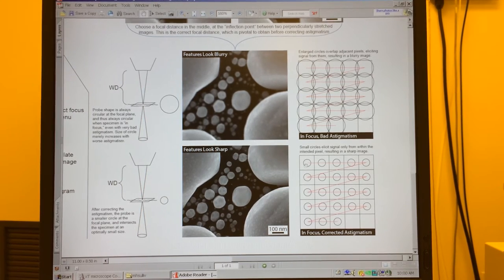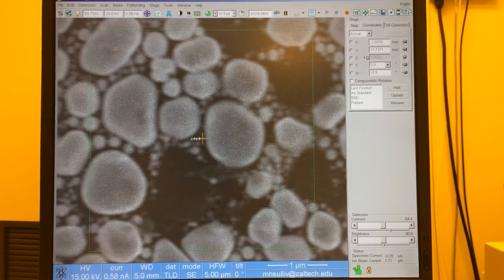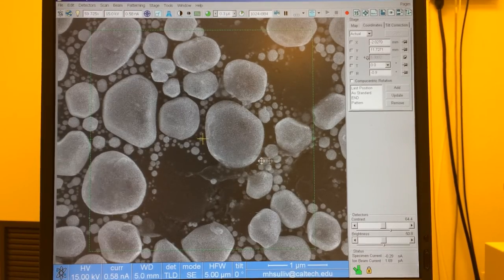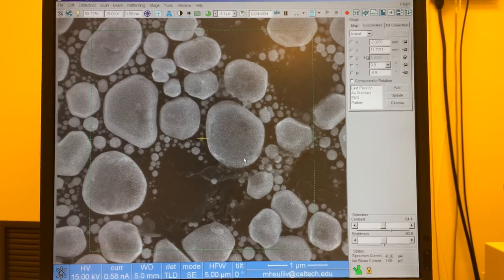So that's a description of how we're getting all these different images. And it's just a matter of iterating that process where we want to find focus and then use our astigmatism corrections to sharpen up the image.